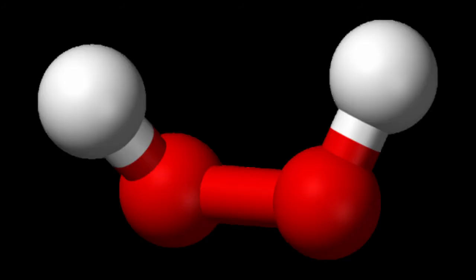In this video, we will take a look at the catalyzed decomposition of hydrogen peroxide. Let's first examine hydrogen peroxide itself. As you can see, the molecule comprises two oxygen and two hydrogen atoms, where the orientation of the hydrogen atoms is at a right angle.